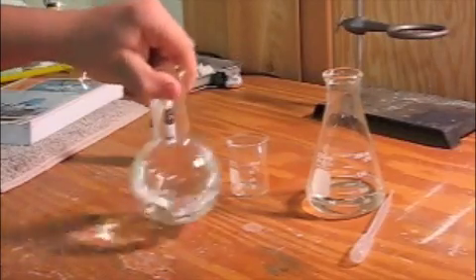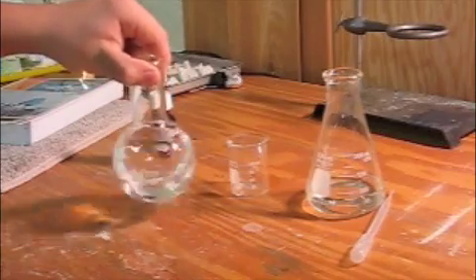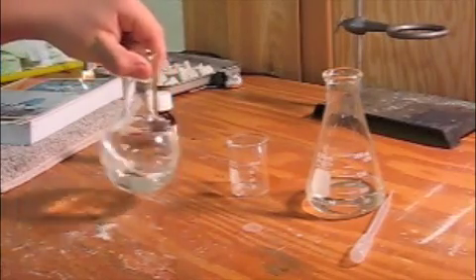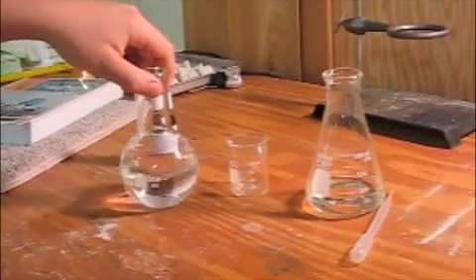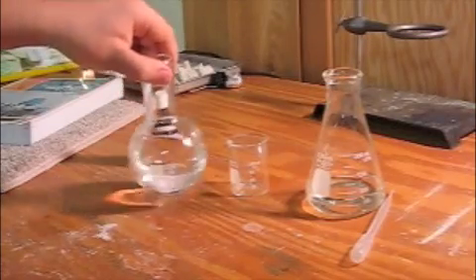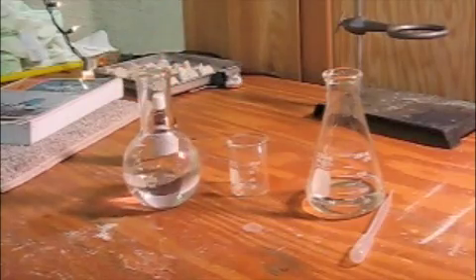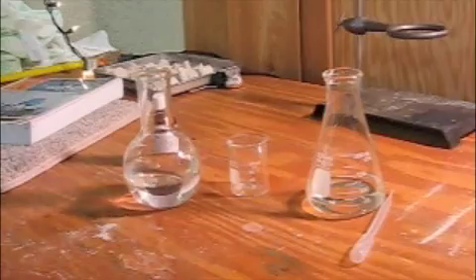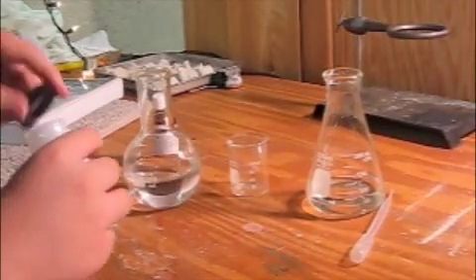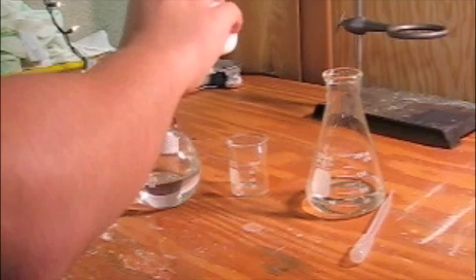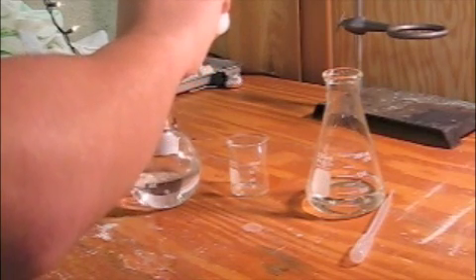Our goal is to reach a concentrated solution. So I'm going to get some more crystals and put them into the solution, as you can see there.